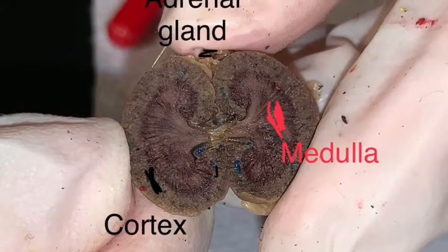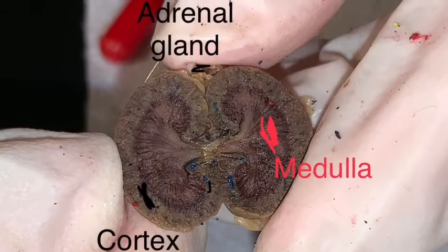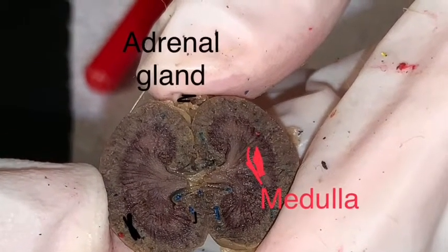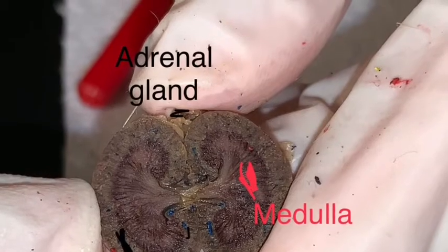The medulla and cortex are part of the kidney, and that's where blood passes through. The adrenal gland is used to secrete adrenaline.